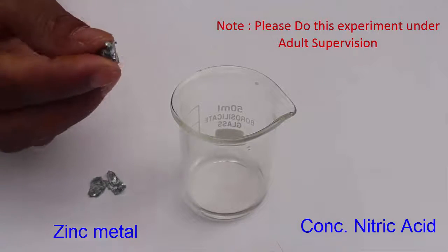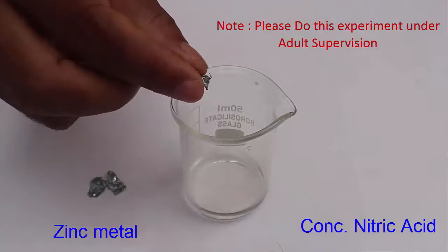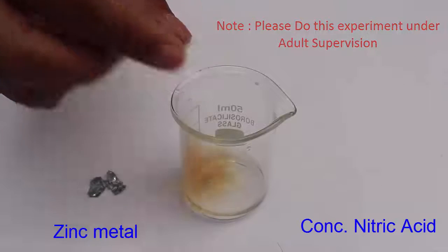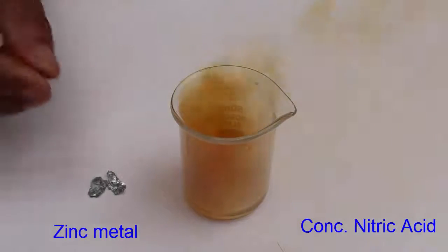Now in the beaker you see concentrated nitric acid and here are a few pieces of zinc metal which we add to the nitric acid.